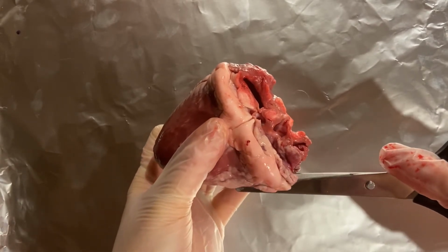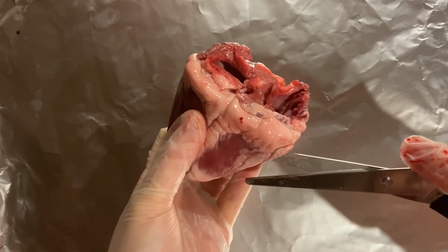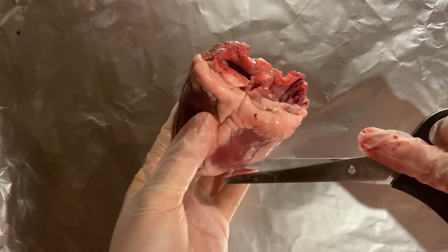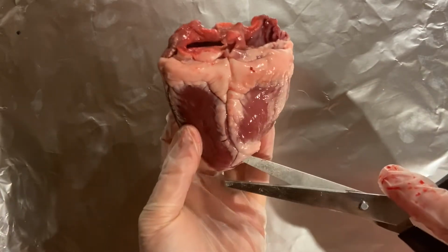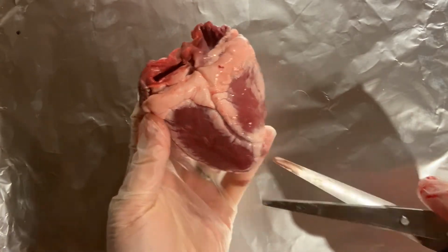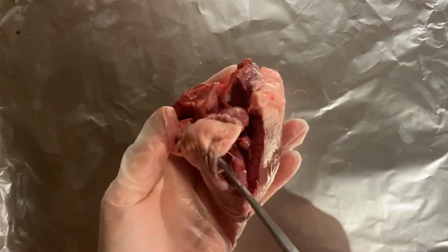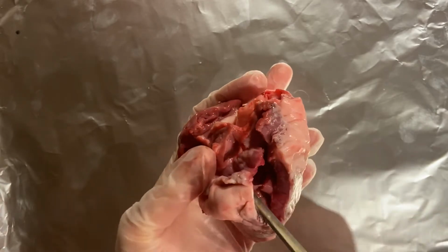Because I'm doing this at home, I don't have my usual dissection kit with me. So I'm just going to go in very slowly and very carefully, if you're just patient with me. Look over here. Yep, quite happy with that.